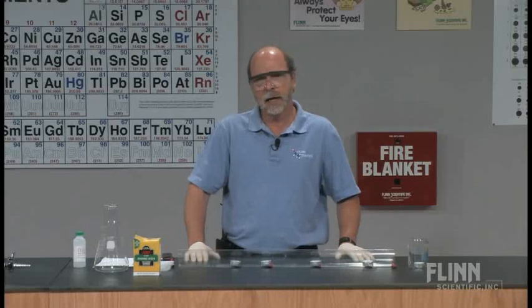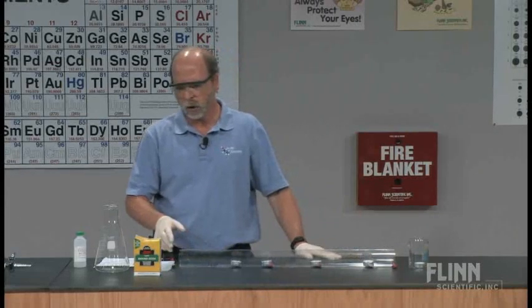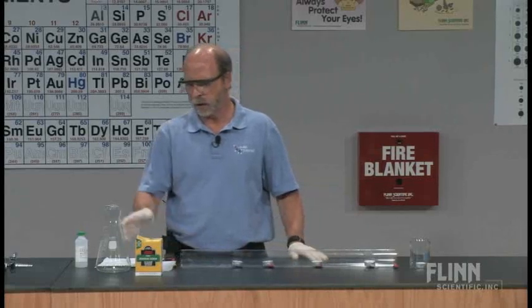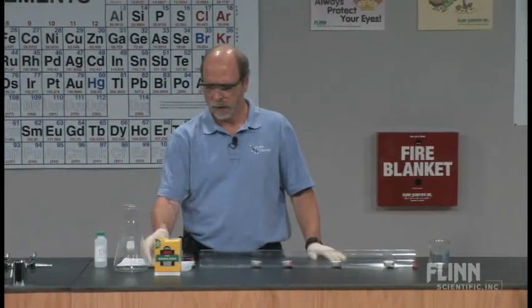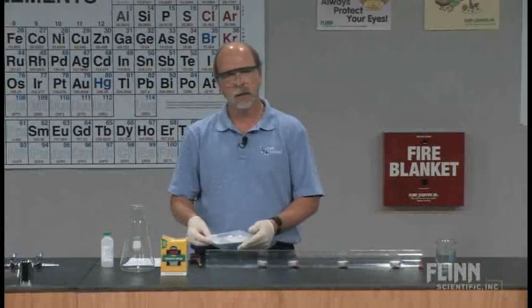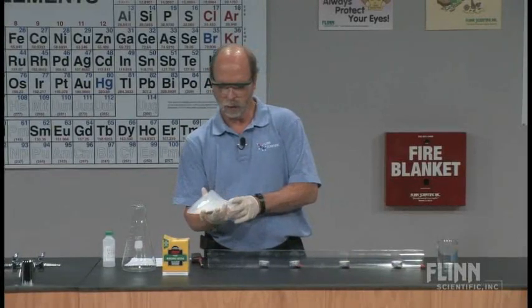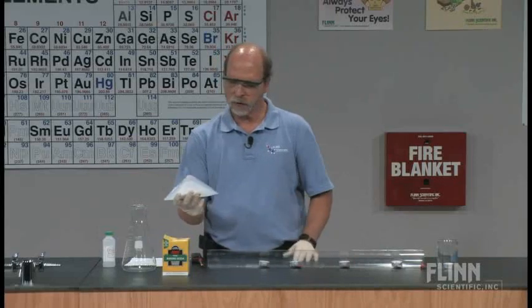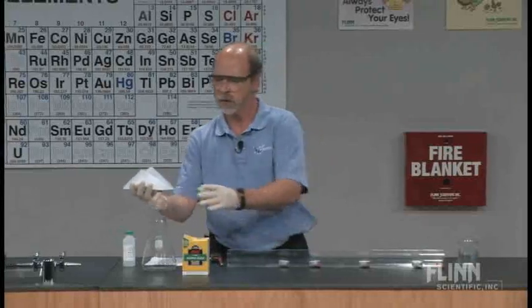I'm going to light the candles. And as well, I'm going to add the baking soda, the sodium hydrogen carbonate, to a flask that I have here. And then I'm going to react the hydrochloric acid with the baking soda to form the carbon dioxide. First, because we're going to lower the lights, I'm going to pour the solid, and it's a lot easier to see that way.